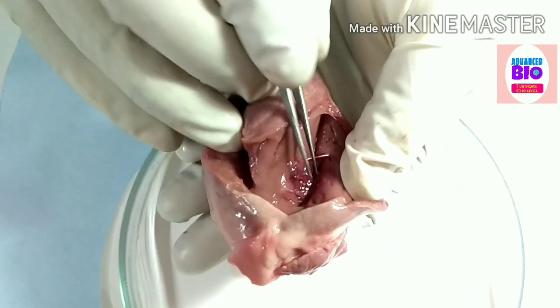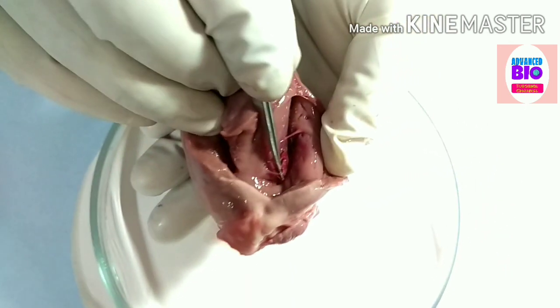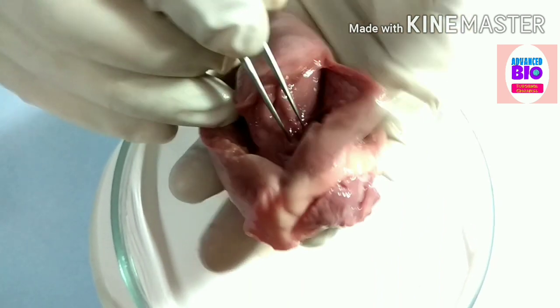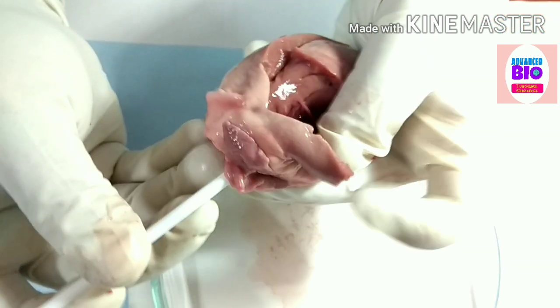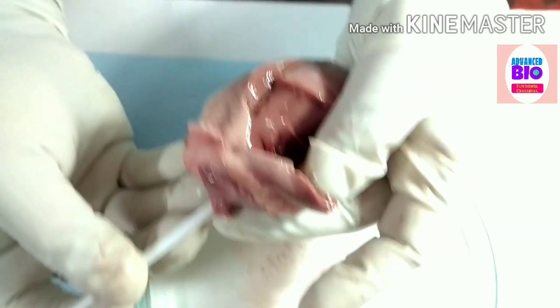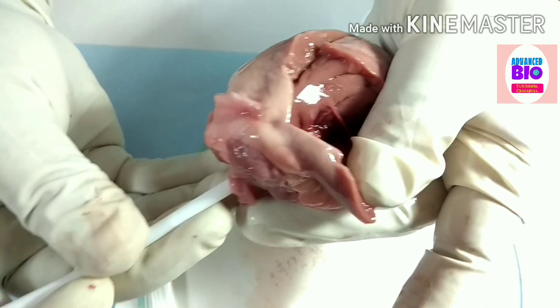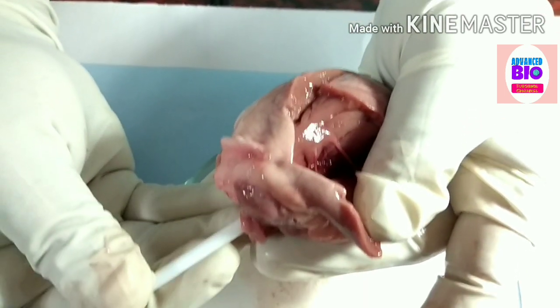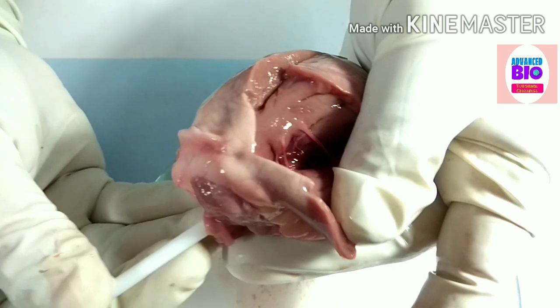The chordae tendineae remain attached to this valve — this is the tricuspid valve. I am showing you the tricuspid valve. See, this is the tricuspid valve and the chordae tendineae remain attached to it.